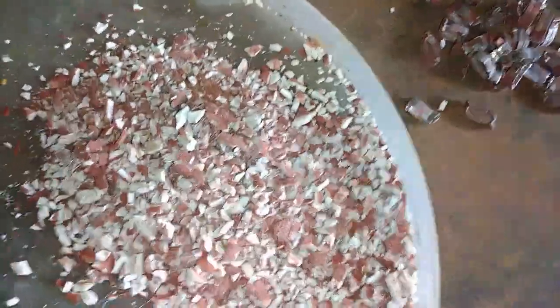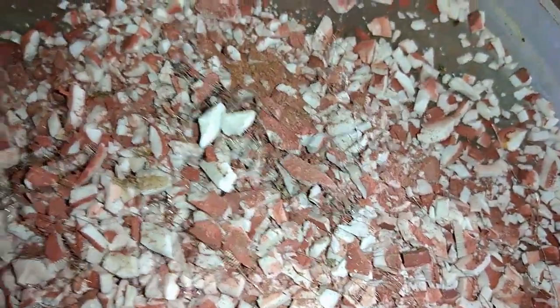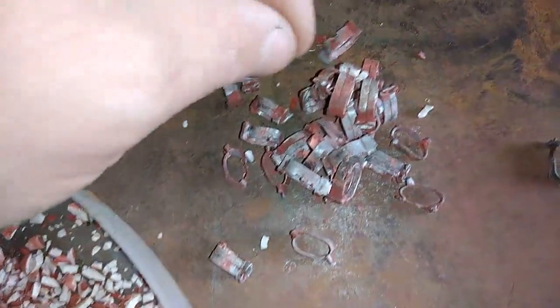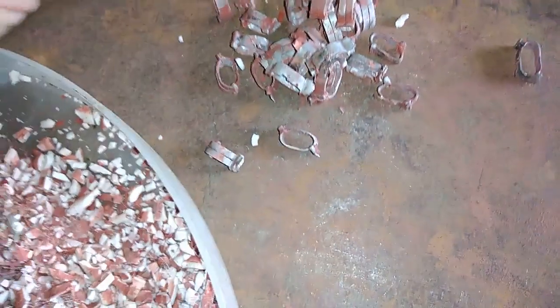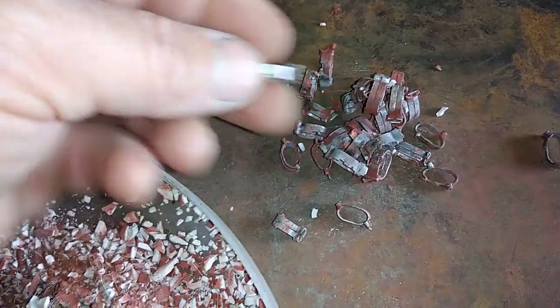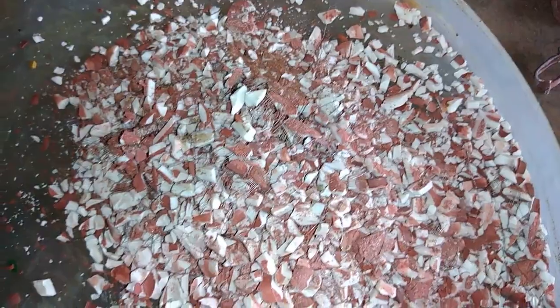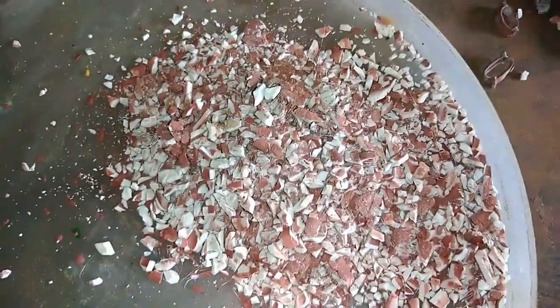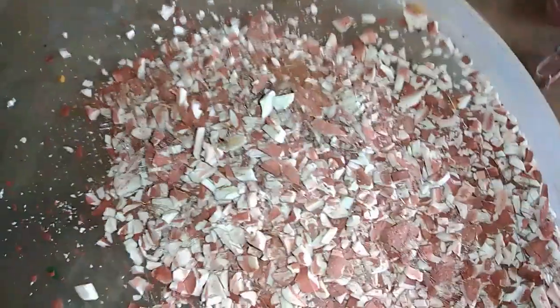I've cracked this stuff. You can see on the top all that silver alloy wire, and I've removed that. I got a couple of pieces of wire there. I removed the ends of the resistor — these are not silver plated, so this is just scrap metal. This little pile here goes in the beaker and I will add nitric acid to dissolve all that wire.